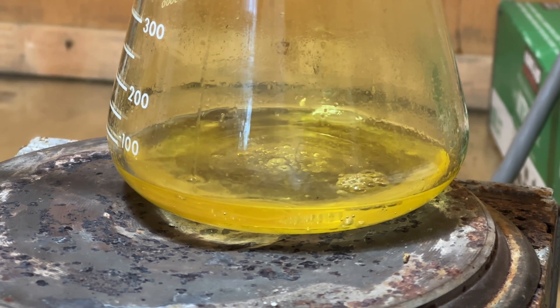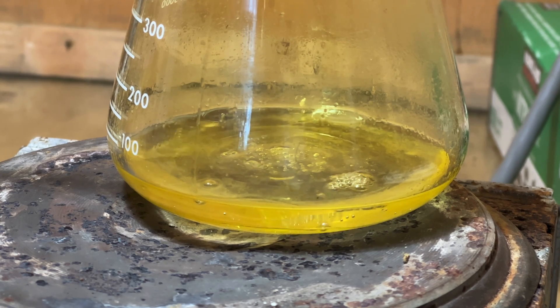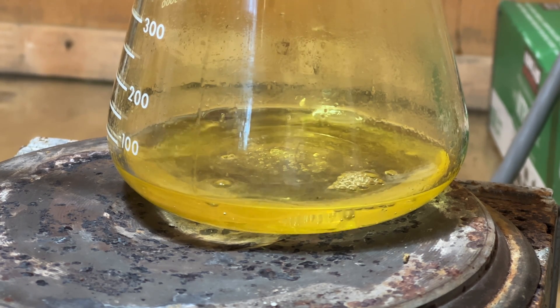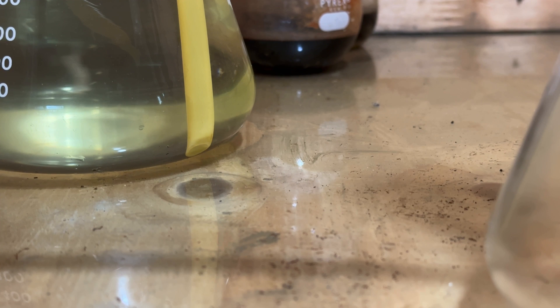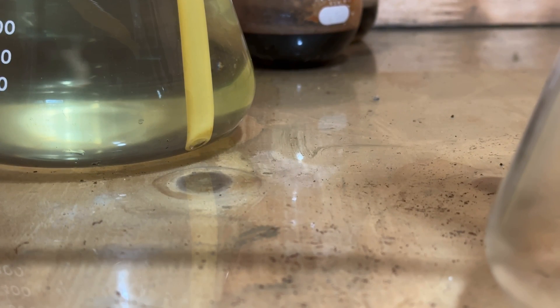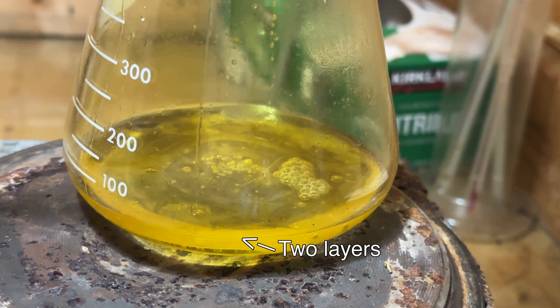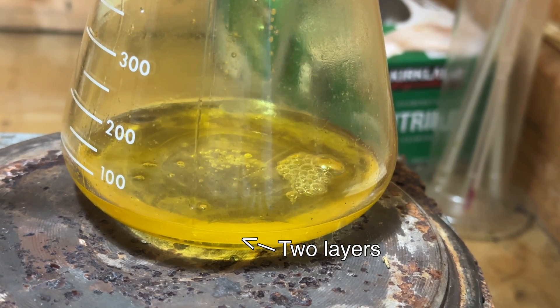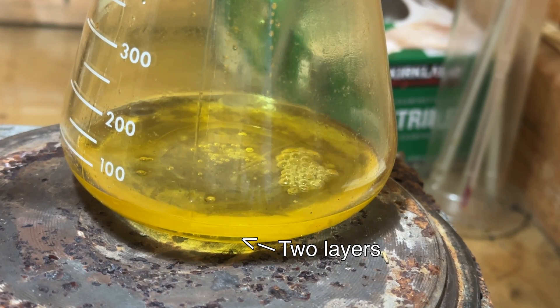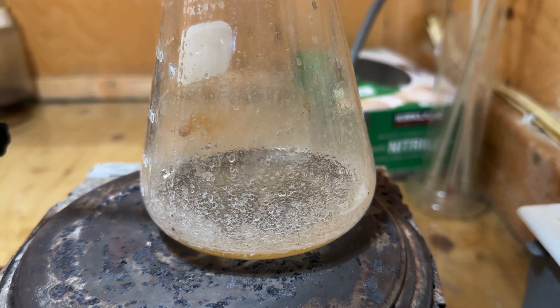Initially, the tin(IV) chloride also liberated dissolved chlorine gas, which remained from the previous synthesis. For obvious reasons, this reaction must be performed in a fume hood. As the reaction proceeded and hydrogen chloride filled the apparatus, the bubbling nearly ceased as the hydrogen chloride was dissolving directly into the water before it could even leave the tube. Interestingly, the sulfuric acid and tin(IV) chloride initially formed two layers in the flask as they were immiscible, but as the reaction proceeded, one homogeneous mixture was formed.